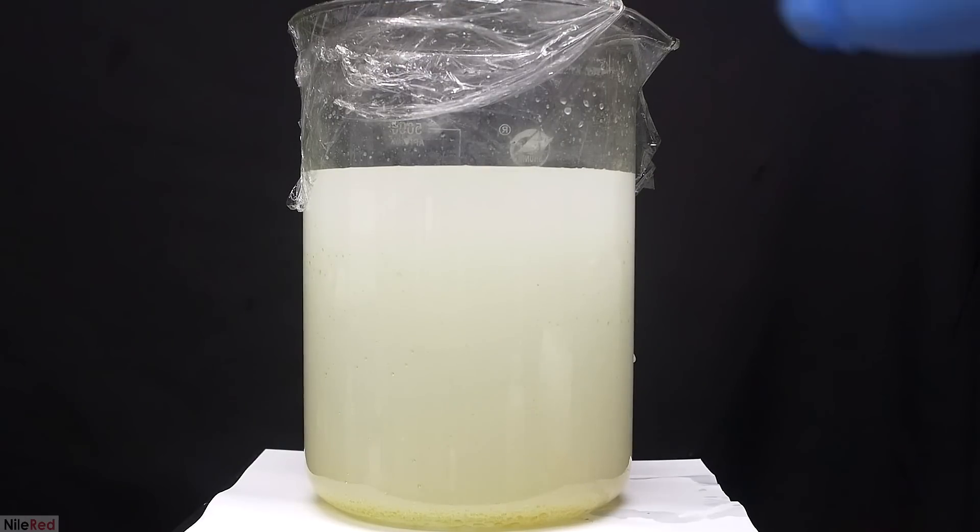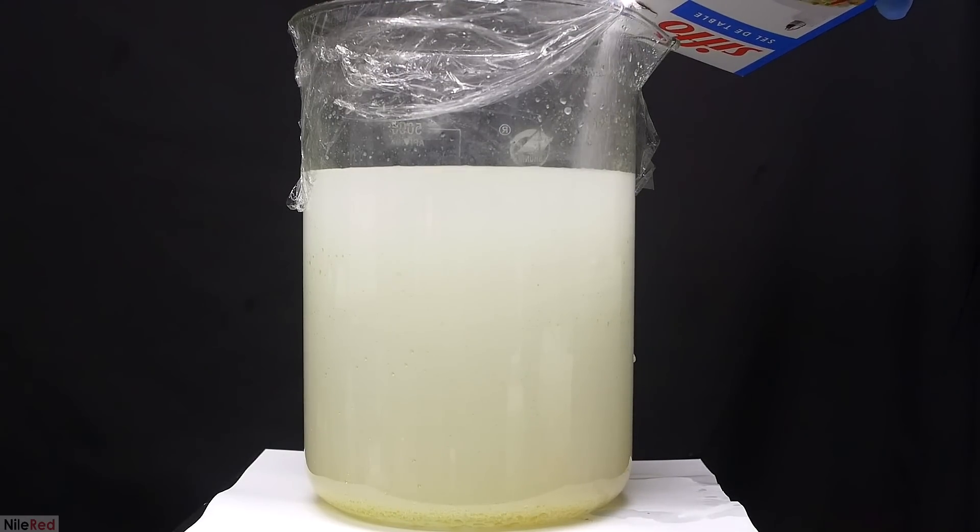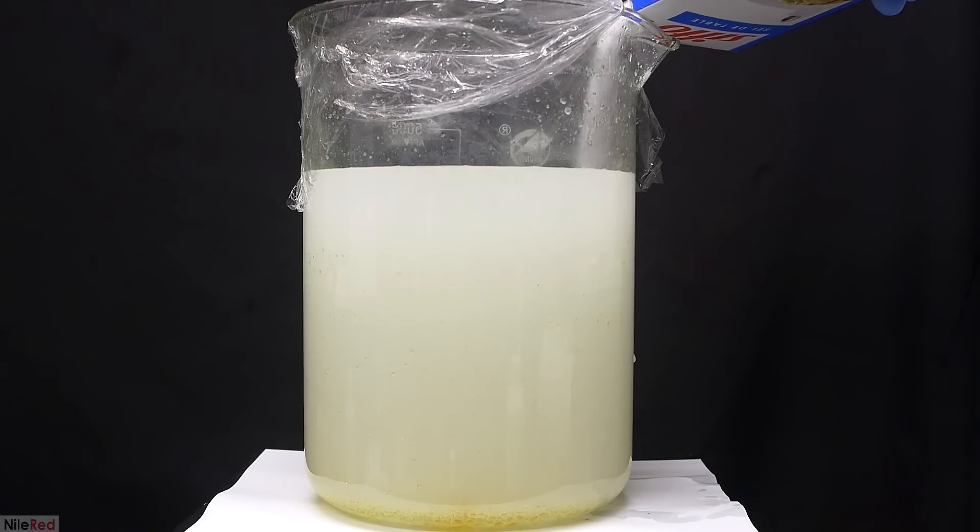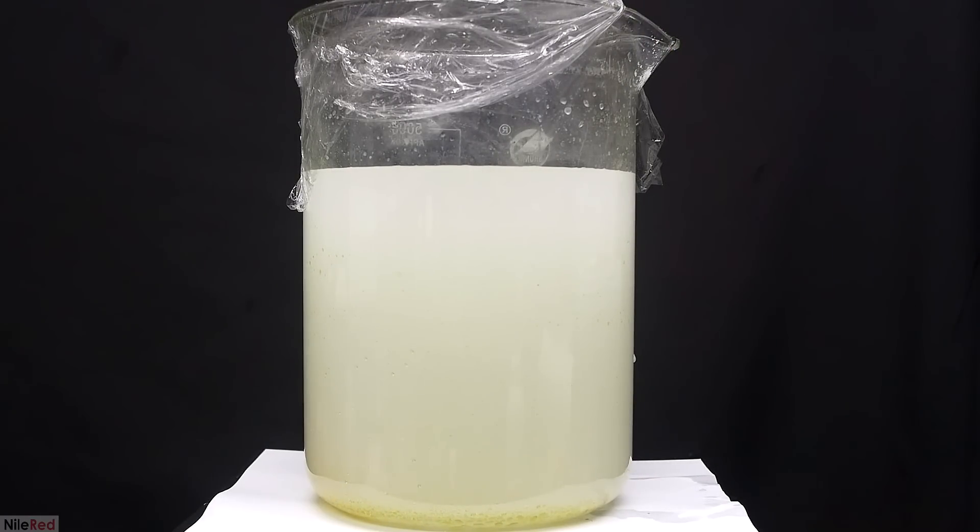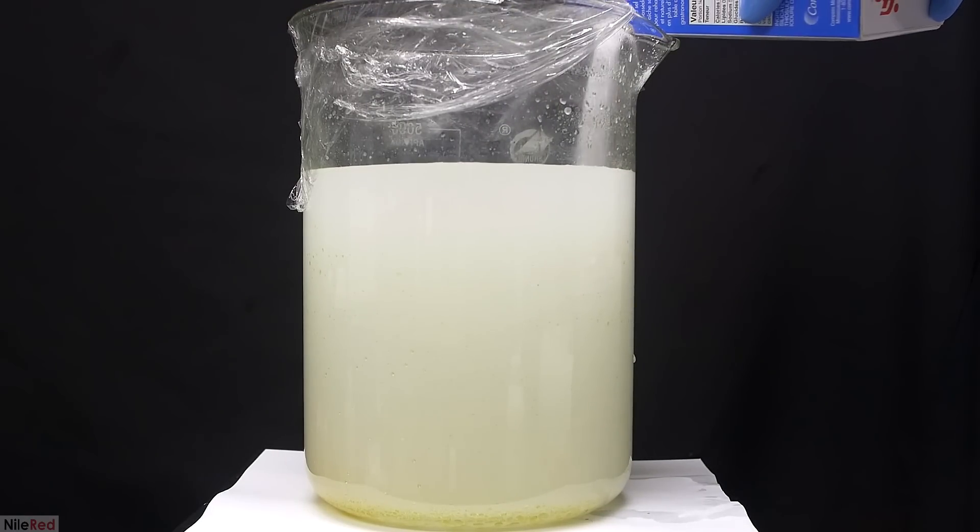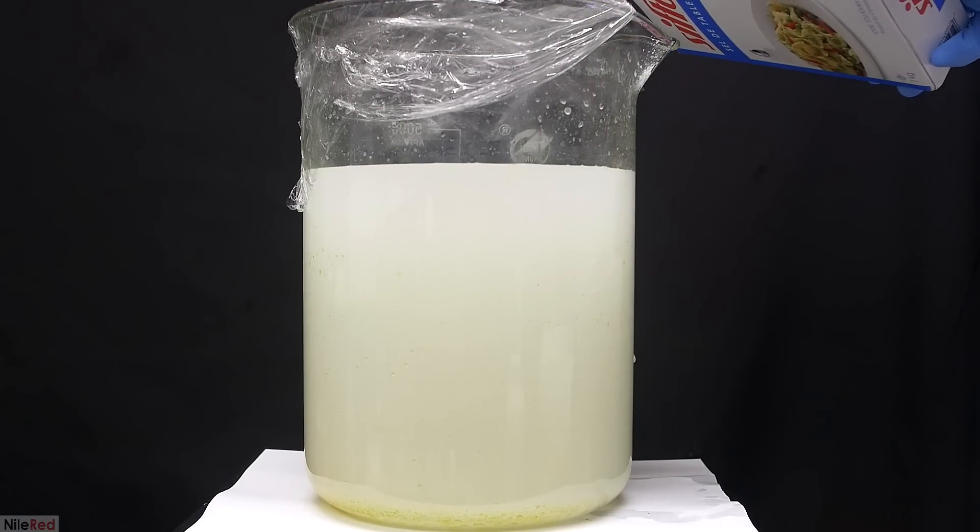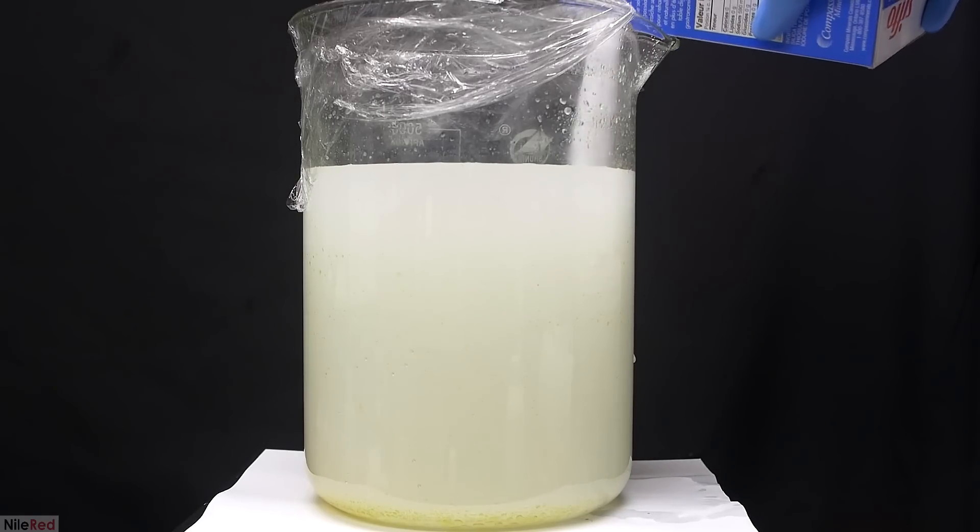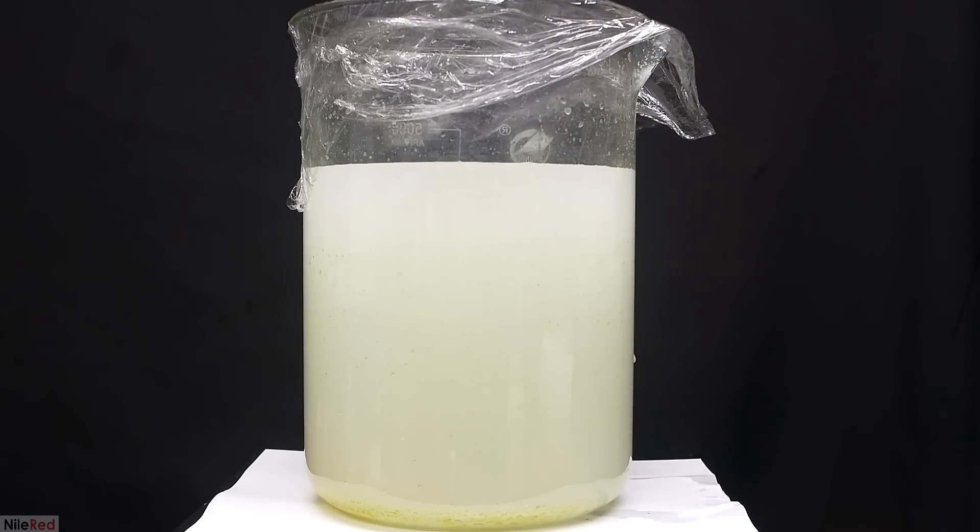The procedure here is pretty simple and what we want to do is saturate the water with salt. This part doesn't have to be exact at all and it really doesn't matter if too much salt is added. Once we get a saturated salt solution, the density is going to be higher than the oils, so the oils will float to the top and undissolved salt will stay at the bottom.